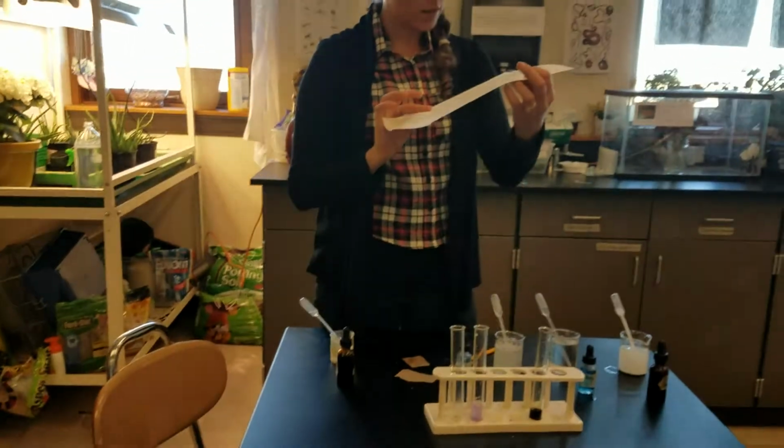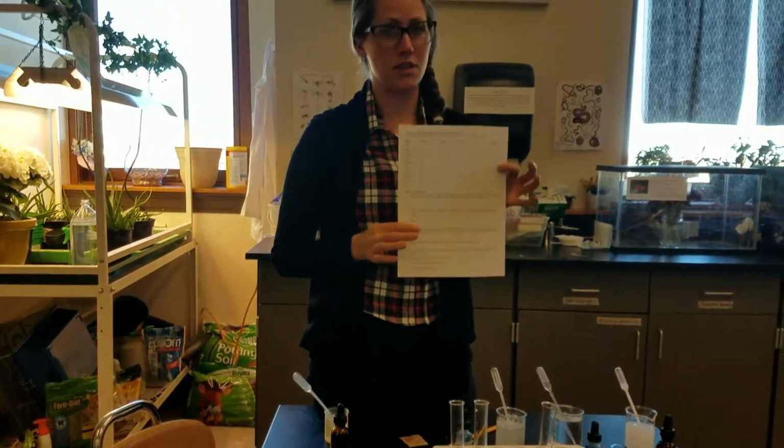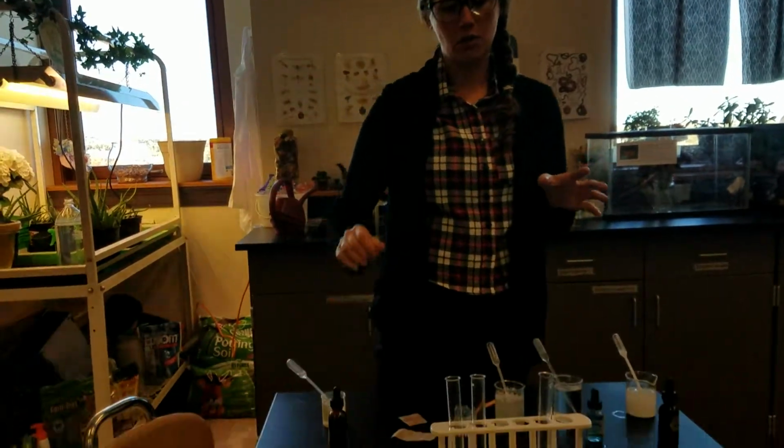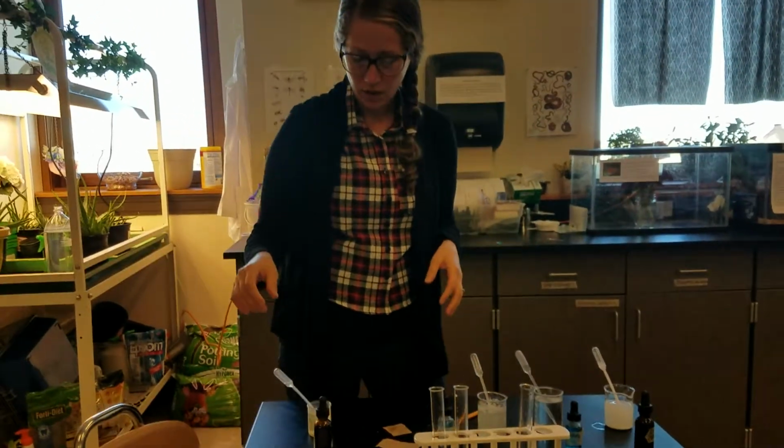On the back of your lab, you'll see there is egg yolk. I'm just going to tell you straight up right now, that's pretty much just protein and fat and nothing else. I'm not even going to have you test that one. You can just write that one down right now.